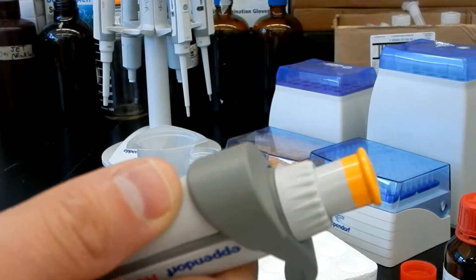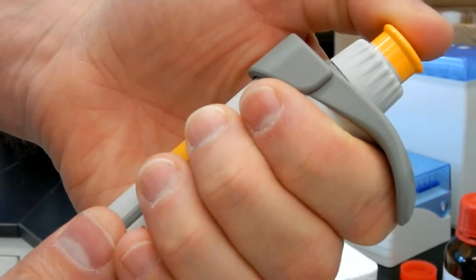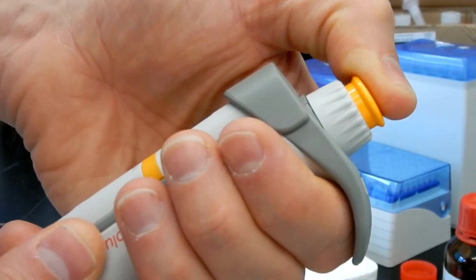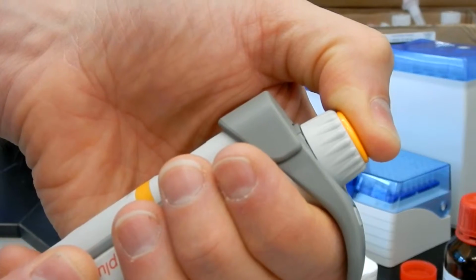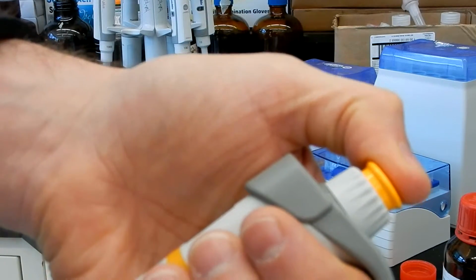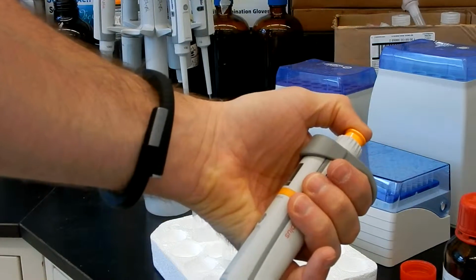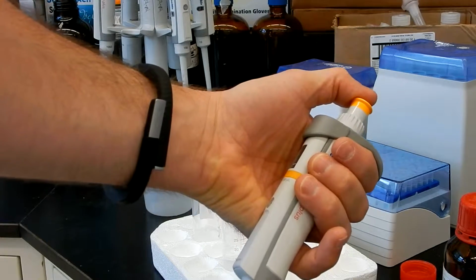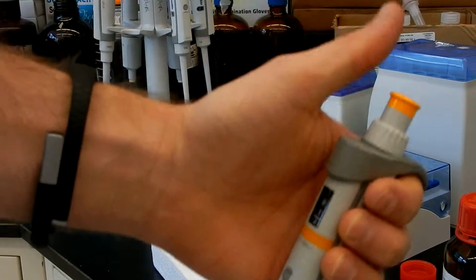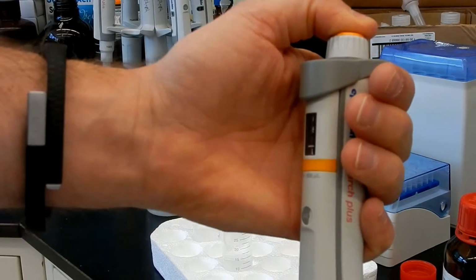So on the piston you have three positions. You have the normal position, which is the up one. Then if you press on it, you will feel a first resistance around here, and then the third position is completely down, so you press a little bit harder and you will go down. When you want to sip the liquid, you press the button to the first resistance, you go in your liquid with the pipette, and then you release the piston slowly and the liquid will get sipped in. Then you move on to the next container you want to drop your liquid in, and then you press slowly on the piston and then push completely down to expel the whole thing.